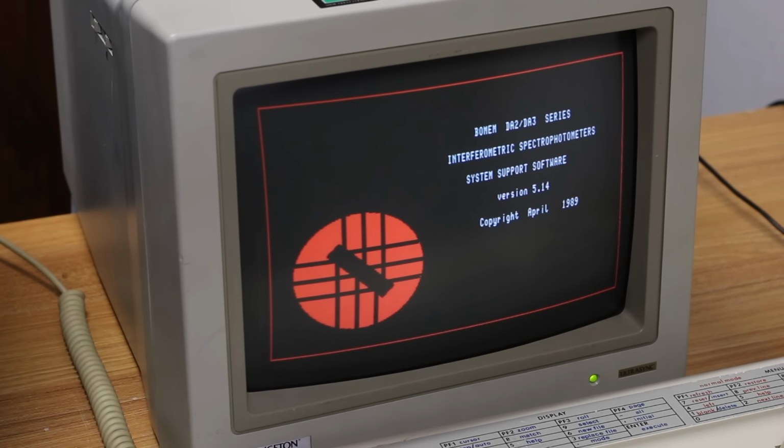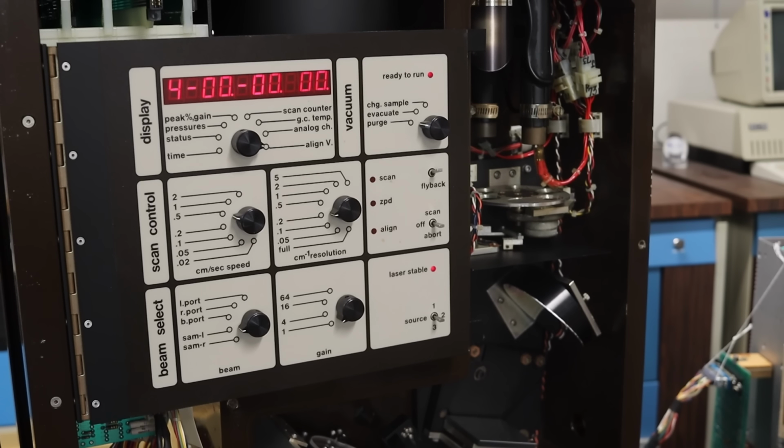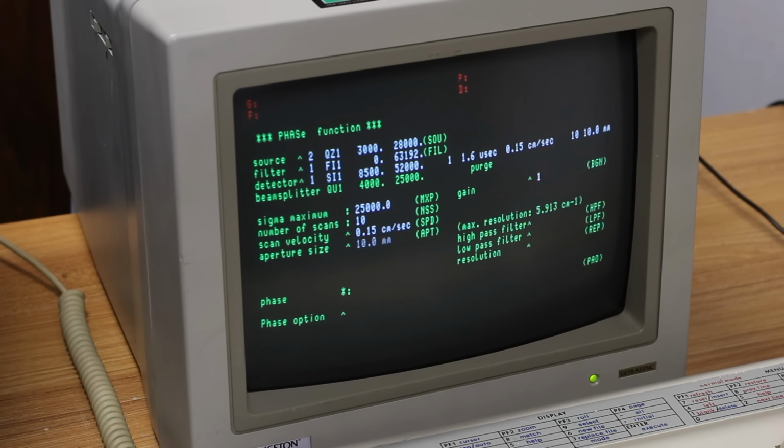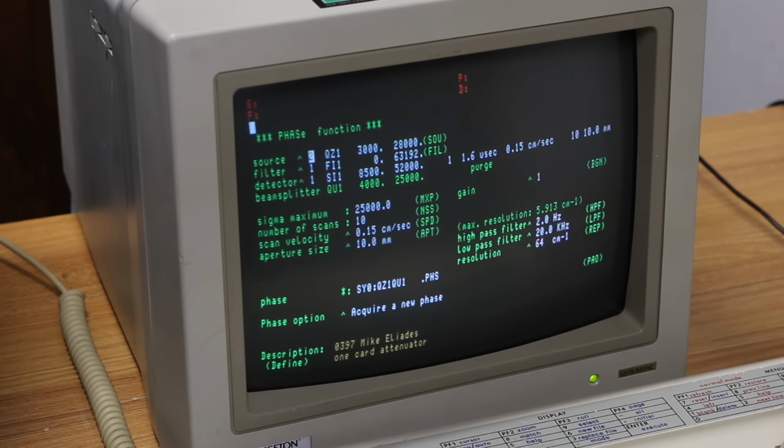The Bomem itself is still sitting in mode 4. I would expect it to change modes here momentarily, hopefully. Let's just start with a PHAS. Let's go ahead and hit return on this.